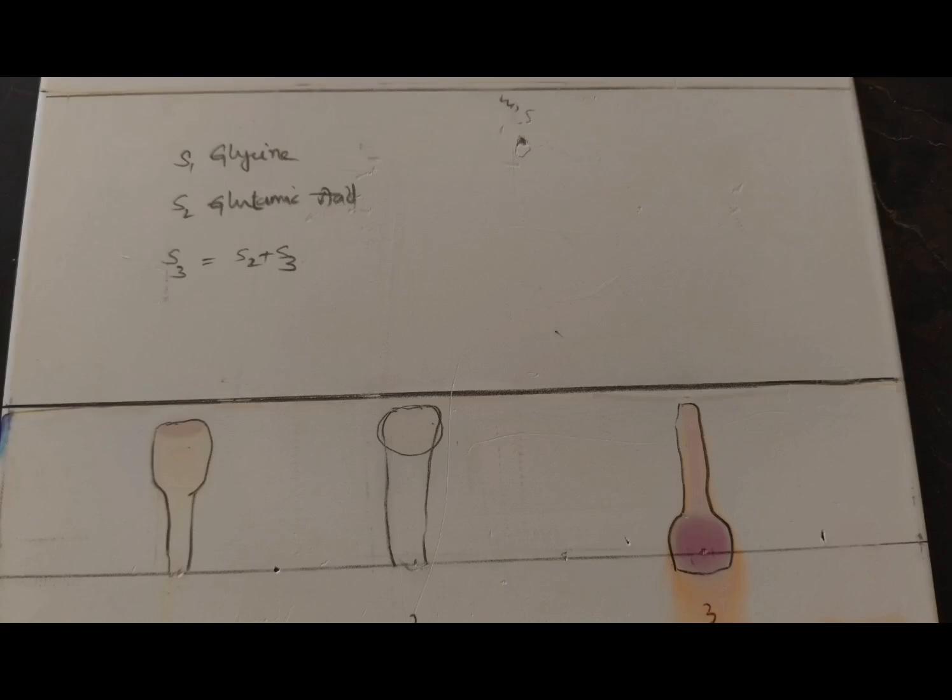So after finishing the spraying, after drying, we get the spots like this. 3 different samples with different spotting is observed practically. So they will mark now on this, and they will measure the centimeters traveled by the spots from the bottom to the solvent front. So this is TLC spotting, 3 samples. Since both are the same samples, we got the same type of separation for both. So after this, we'll make the calculations.